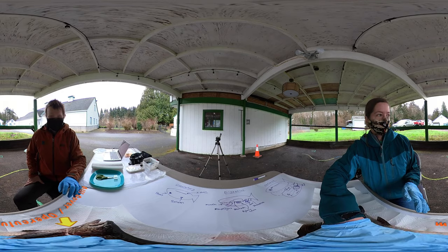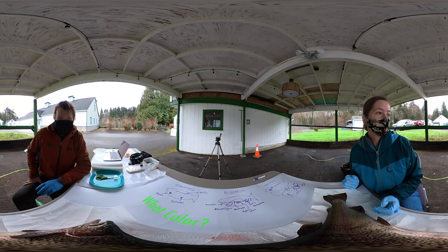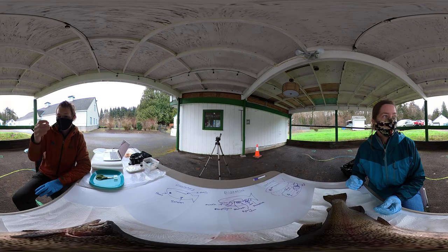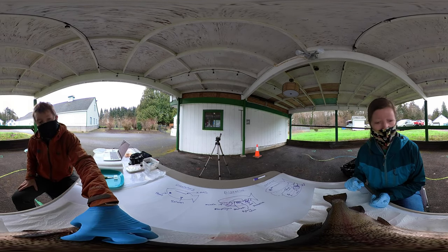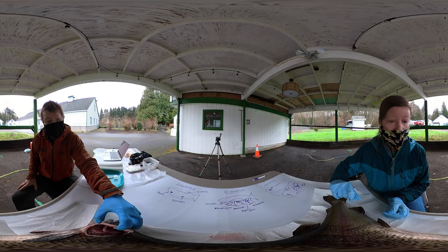You could lift that up, but before you do, we're going to look at the gills underneath. What color do you think the gills are going to be? I think they're going to be red. In humans the whole purpose of the lungs is to get oxygen in the body and let out carbon dioxide. That oxygen gets to all the parts of your body by traveling in your blood. So my guess is that if this is trying to get oxygen in the body, there's going to have to be a lot of blood close to the surface. So I'll say red. Let's lift it up and take a look. So we're lifting up that operculum — what does it feel like? That's really hard, kind of bony.